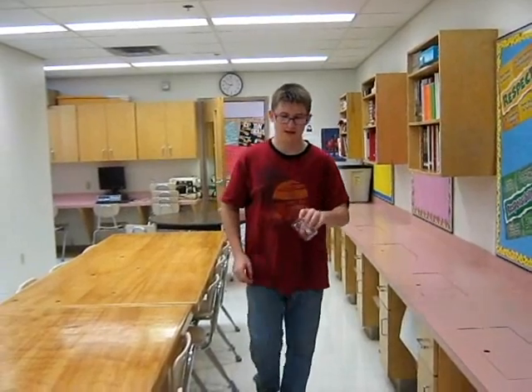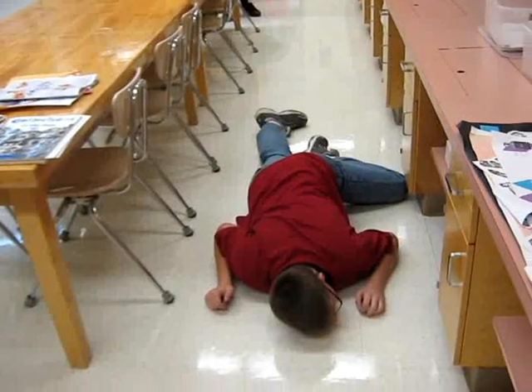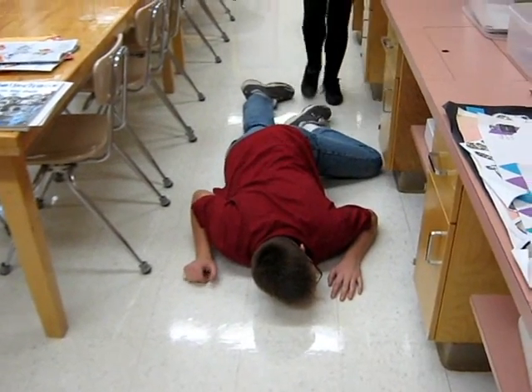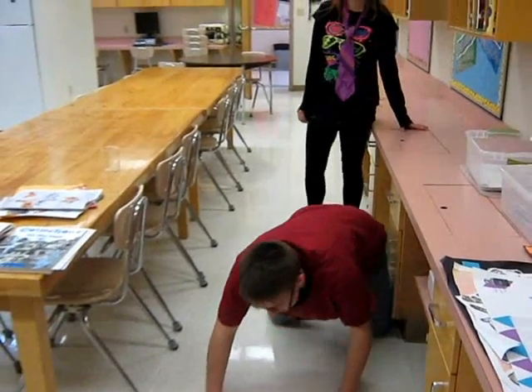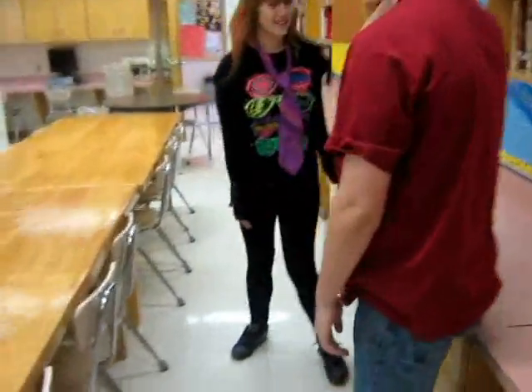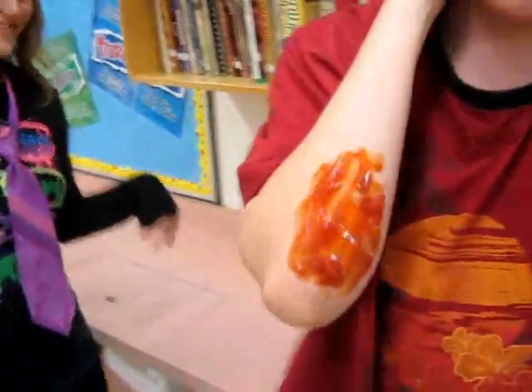I think I could wash this. Oh no! Ow. Ow. Ow. Are you okay? Ow! No, I got glass in my arm. Do you think this is bad? Oh yes, we must go rinse it. Okay, let's go. Ow. Ow.